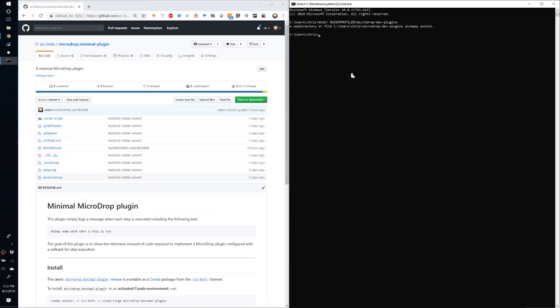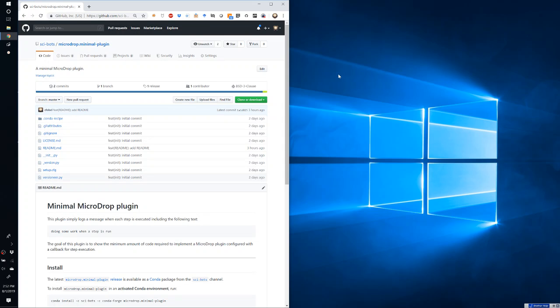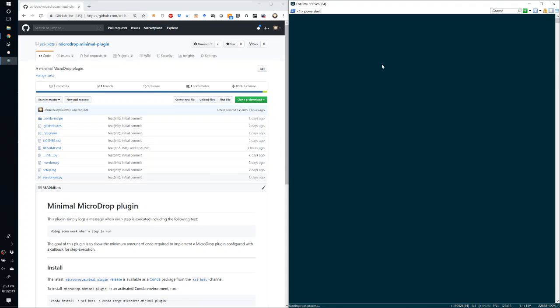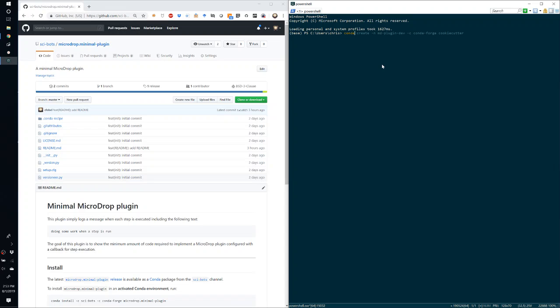Okay, the next step is to start a command prompt in a Python environment on your system. So I'd recommend using a conda environment, but if you have a different Python environment, that works as well. So in this case, I'm going to use a PowerShell environment, but all of the steps should be very similar if you're not using a PowerShell environment. So here I would recommend creating a new environment if you're using conda. So you can use the conda create command.